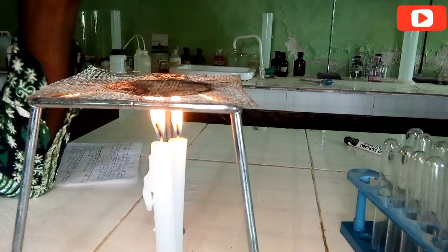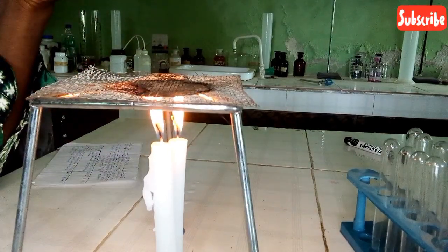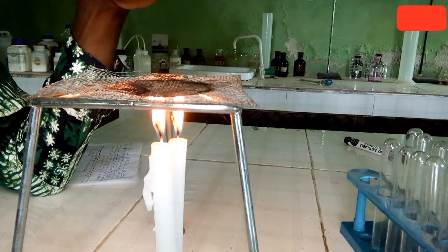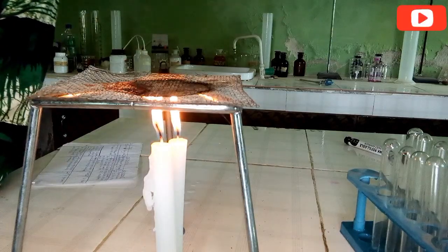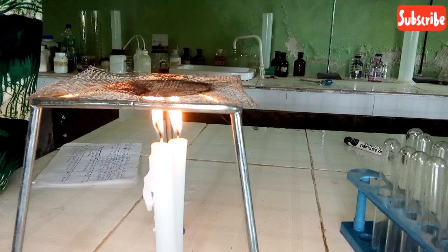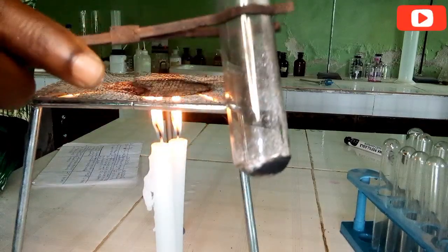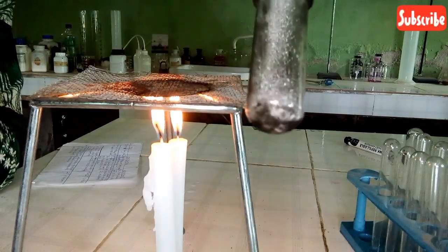I observe a yellow change in the color of D. There is a yellow change in the color, but very, very slight. I don't think you can see that over there, but I can see it. In order not to waste time, I have observed a slight change in color, which is yellow, probably because the heat here is not too strong, so you might not be able to see that clearly over there, but I can see it here.